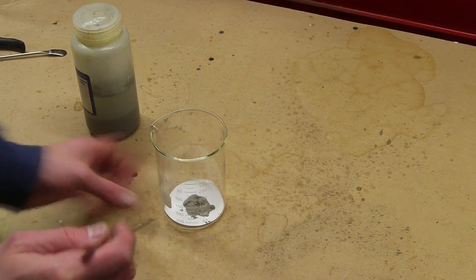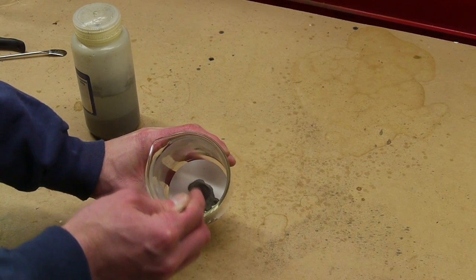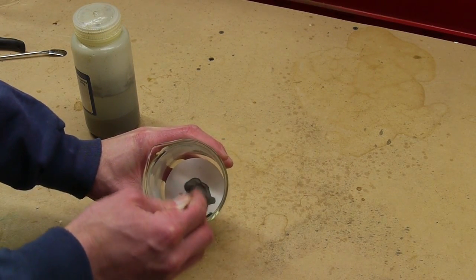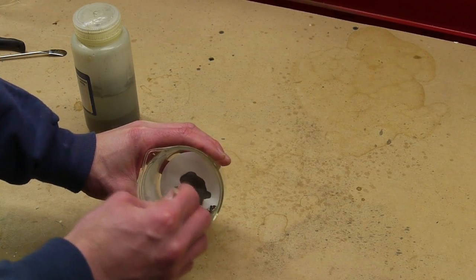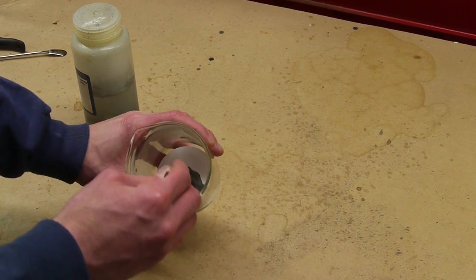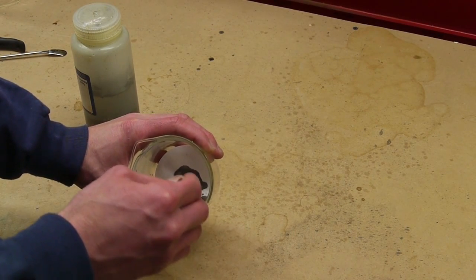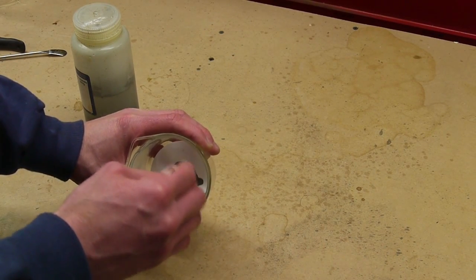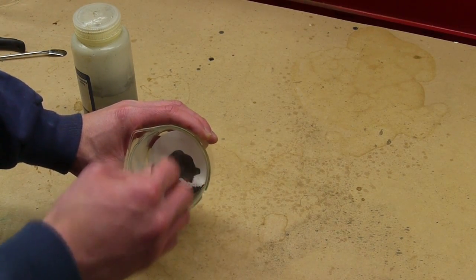So instead, what we're left with here is the dry powder. It's actually still somewhat wet, so maybe we're in that danger zone now, who knows? I only have, you know, maybe a gram or less of it here. And what I'll do is just put some of this over a flame so that you can see it burn. It burns with a really white, intense flame.